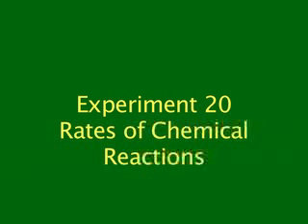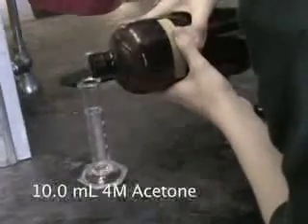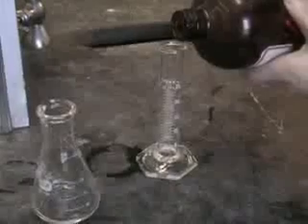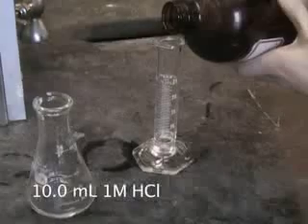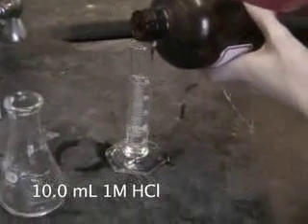In this experiment, we'll measure the rate of a chemical reaction, the iodination of acetone. We will attach iodine to acetone in an acidic environment, making sure that the total volume is the same every time and changing the concentrations of each of the reactants to see what effect it has on the rate.